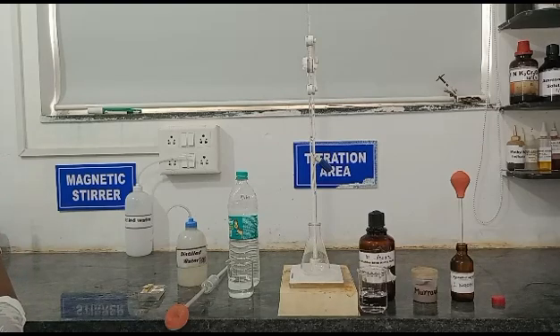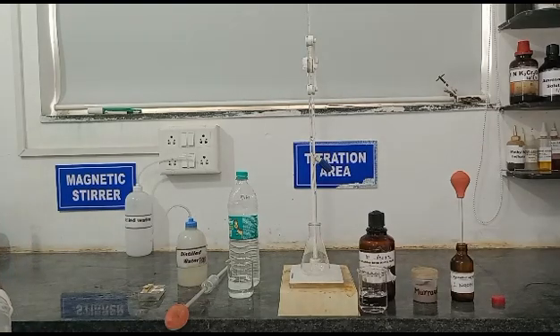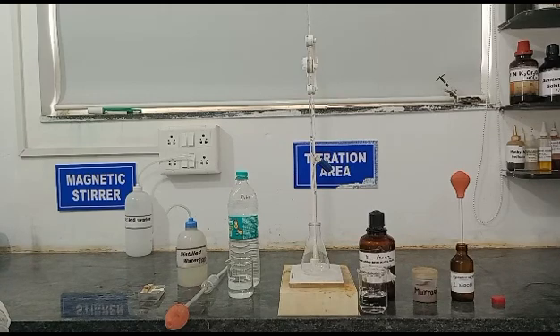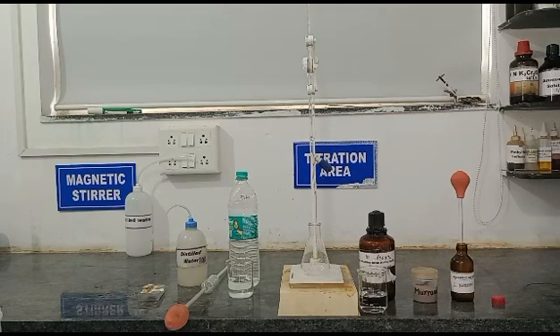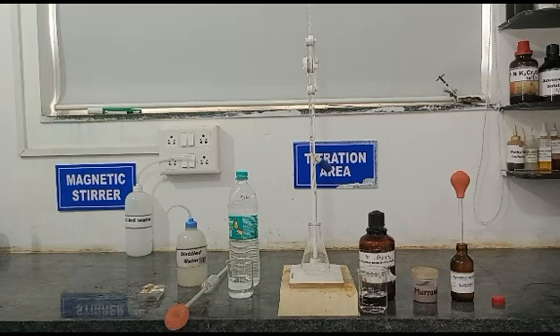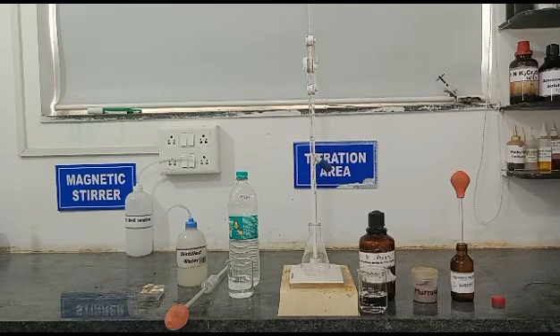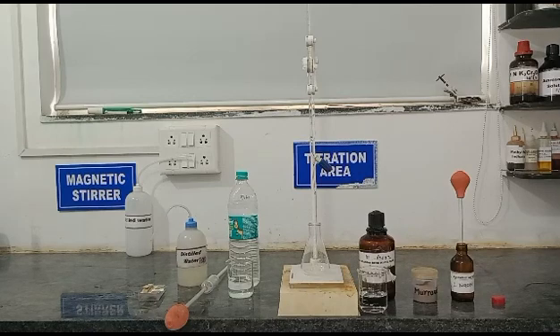Calcium determination is essentially a titration. In your solution which contains both calcium and magnesium, the pH is made sufficiently high — that is 12 to 13 — with the help of 1N NaOH, so that the magnesium from your water sample will precipitate as hydroxide, and the indicator you are going to use will combine only with the calcium.